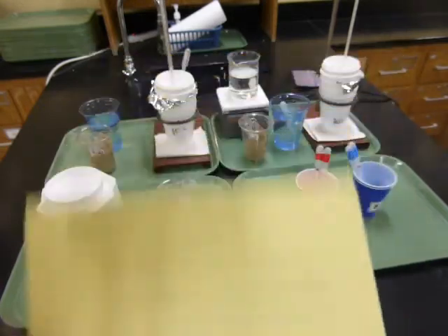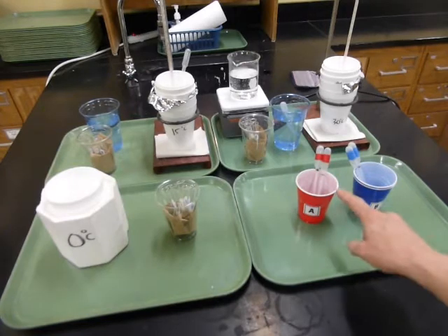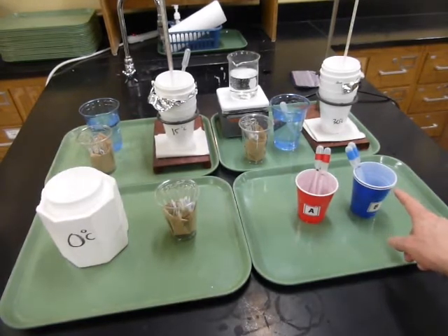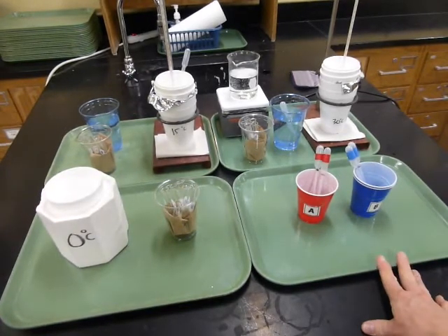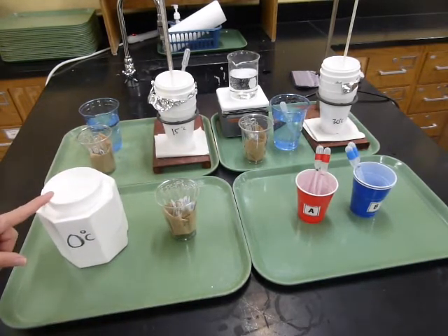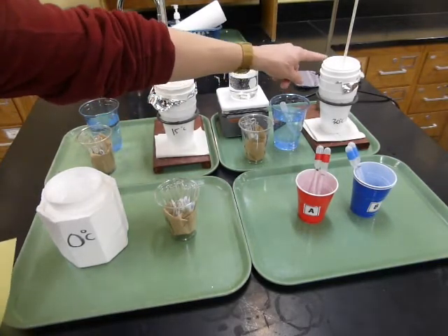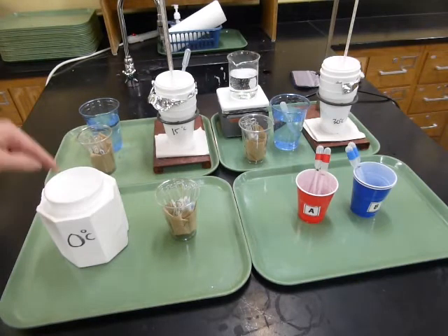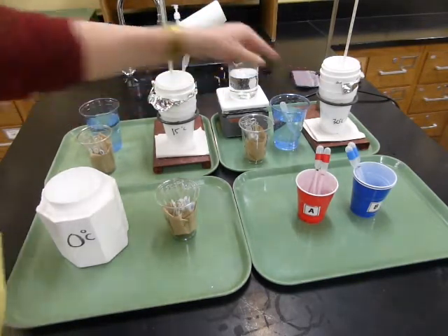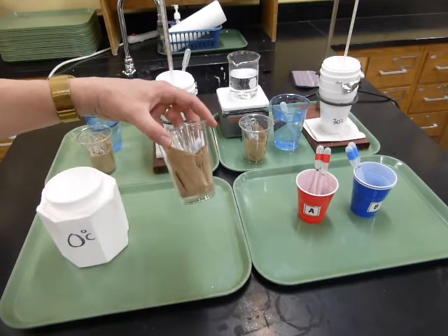Our goal today is to use the same chemistry that we were practicing with in the last experiment with the clock reaction to see what happens to the reaction rate when we change the temperature. We're going to use 3 different temperatures: 0 degrees, which is cold, 15 degrees, which is cool, and 30 degrees, which is warm. So we're going to have to make water baths at those specific temperatures and keep them constant during the duration of the experiment. The other thing that we'll need to do is fill up test tubes with the solutions.